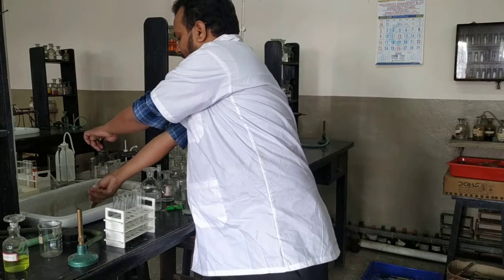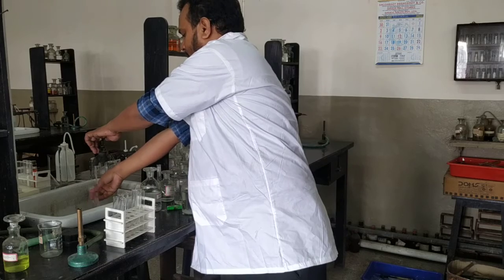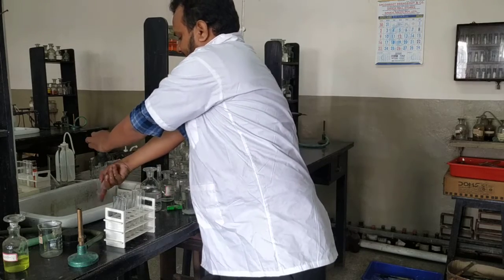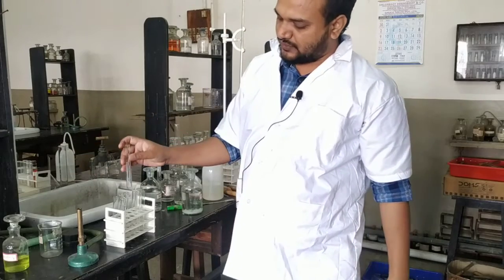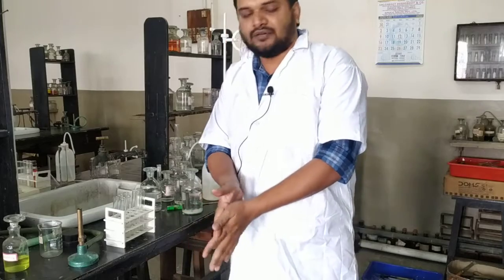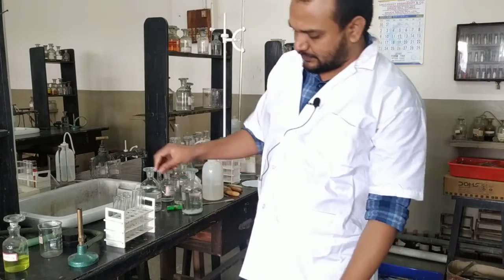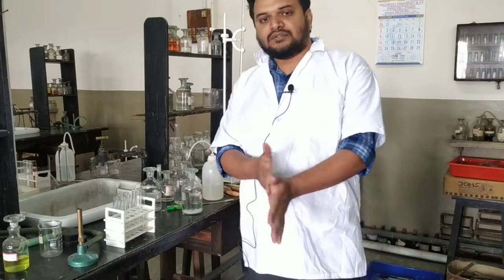So in this way, if group 4 cation is present, first you show group 0, group 1, group 2, group 3 absent, then you confirm group 4 present. After group 4 is present, you do the confirmatory test for the cation for group 4. Here I was doing for zinc 2 plus and I have confirmed that it is zinc 2 plus, so our cation part is done. Now the anion part.